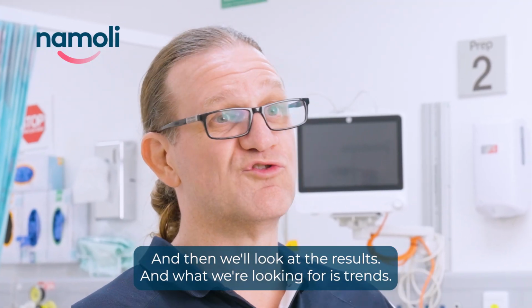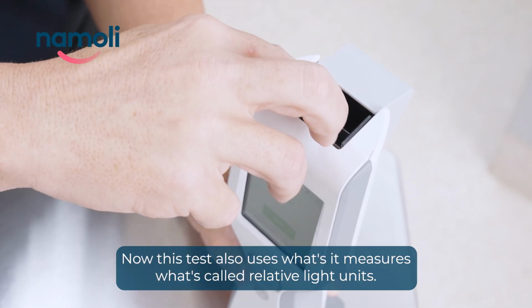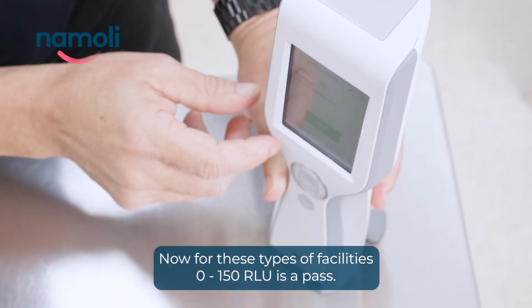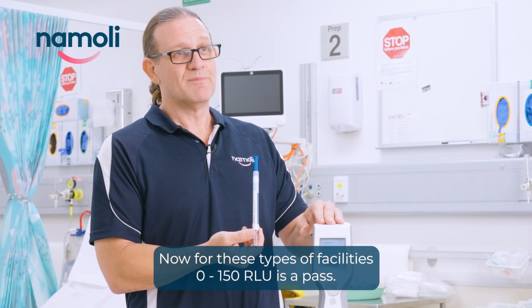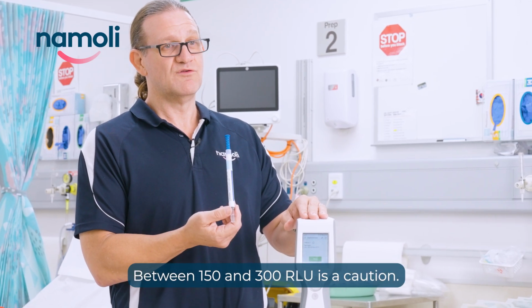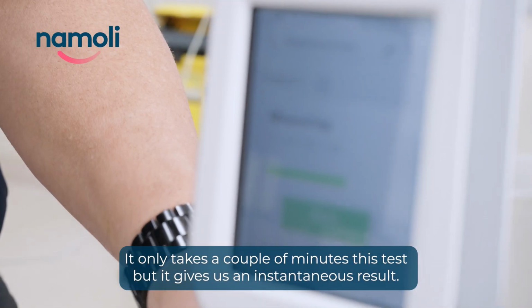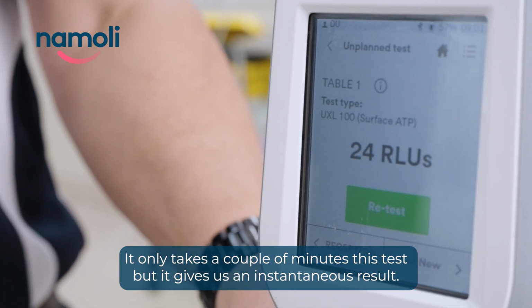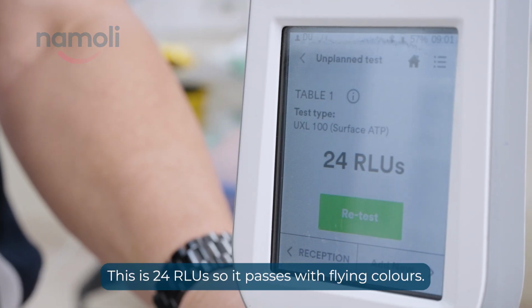And what we're looking for is trends of seeing how the cleaning goes over time. Now, this test also measures what's called relative light units. Now, for these types of facilities, between 0 and 150 is a pass. Between 150 and 300 is a caution, and 300 and over is a fail. It only takes a couple of minutes, this test, but it gives us an instantaneous result. So this is 24 RLUs, this passes with flying colours.